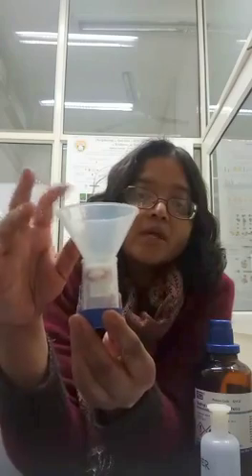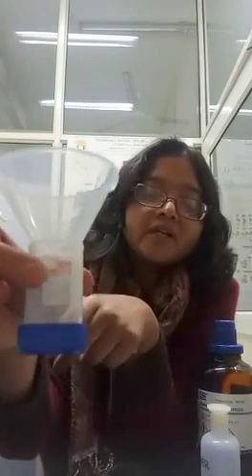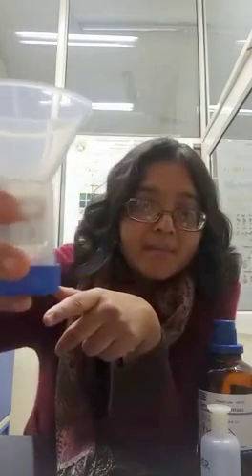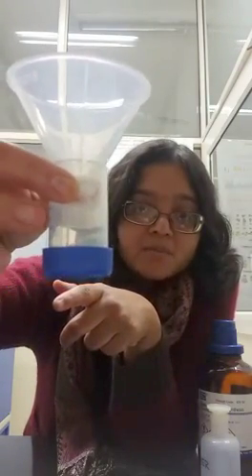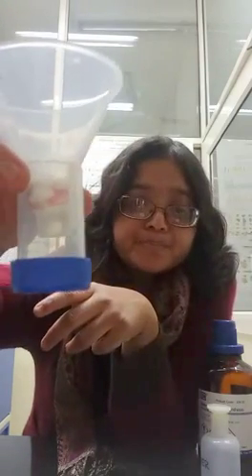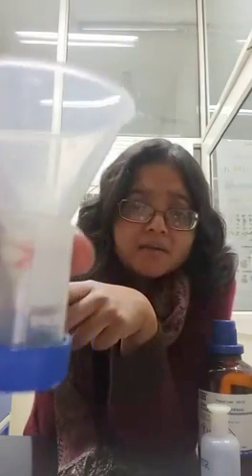We are using this funnel where we have cotton wrapped around it, and this fits quite well in here. You can use a small funnel as well — this is just what's available in the lab right now. So this is the chamber: you can see there's enough space between the bottom of the funnel and the anesthetization chamber where the flies can rest.